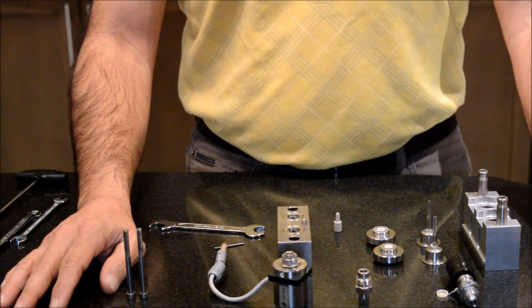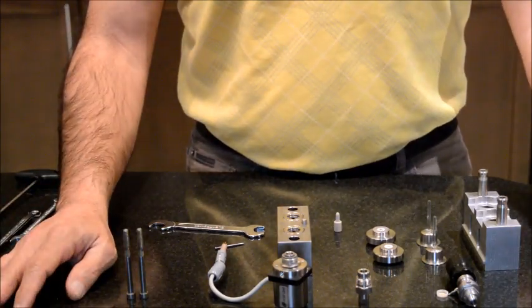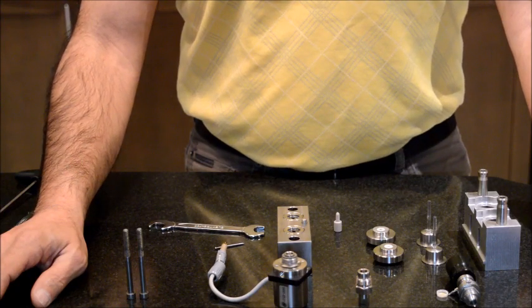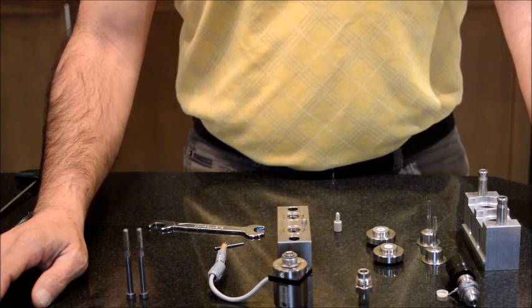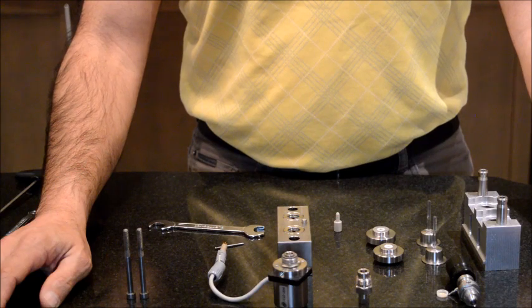Just a message to younger chemists: let's say these chemists are given a task to develop a method and they are struggling with, let's say, two peaks that are coeluting, and they want to have a separation. During the struggle, they have the tendency to forget about their machine. They end up putting a lot of buffer or a lot of pressure on the system. Although they may manage to develop their method, this method would be the one that causes a lot of system breakdown over time. I've seen these methods too many times, methods that cause system breakdown very rapidly. So try to keep in mind your equipment limitations, and try to have practices that are equipment friendly.